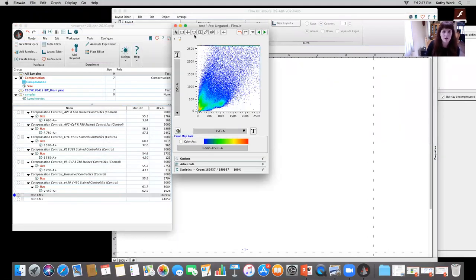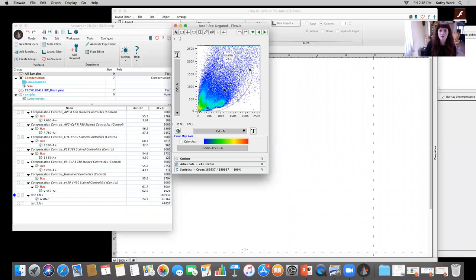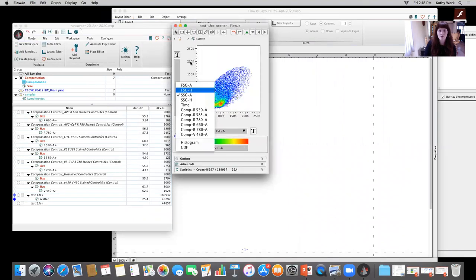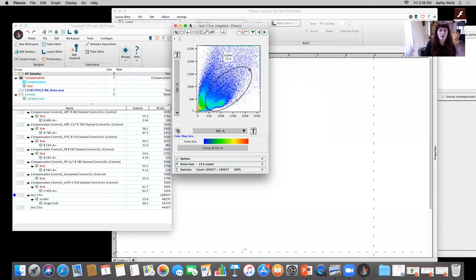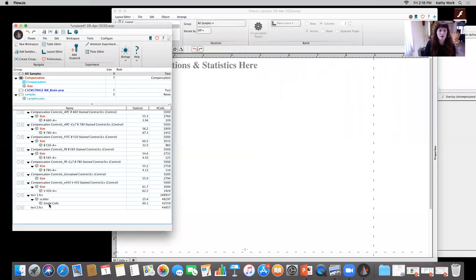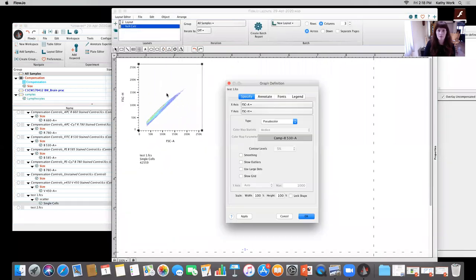I'm going to make sure I gate appropriately on scatter and single cells. Let me do a general scatter gate, trying to exclude most of this debris and singles before I go ahead and do that N by N plot. So I want to show you in the best way I can how to set this up. Okay. So I'm going to drag that single cell population in, drag it up, and then I'm going to do the same thing here.